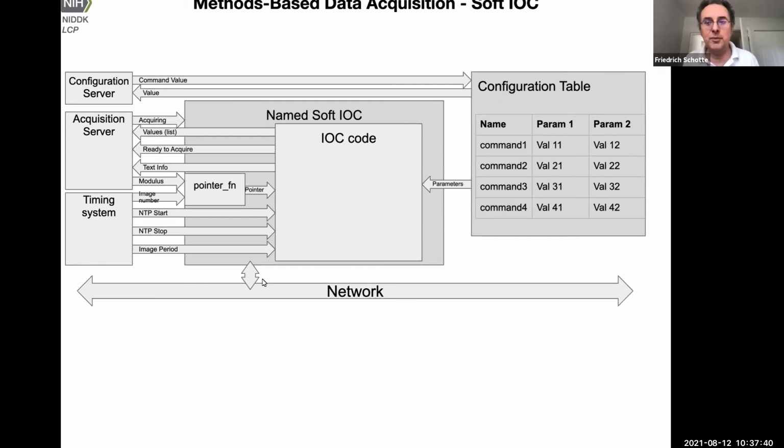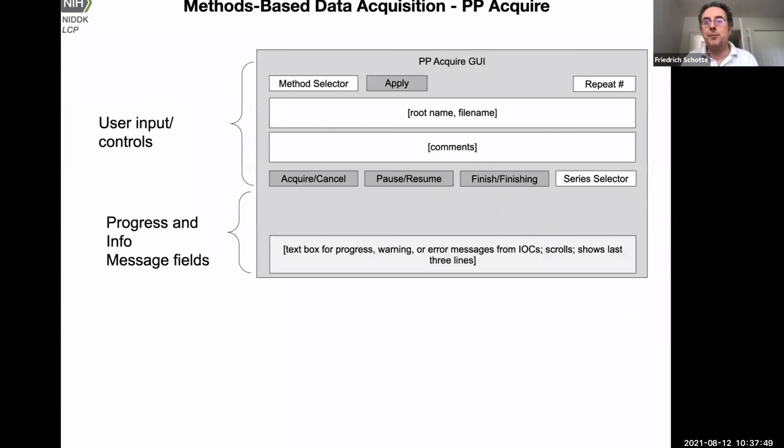And this is a modular principle of designing acquisition software, so that keeps things specialized and extensible. That's the data acquisition GUI. I think I already covered it. So the first thing is to select a method, then apply it, and then you have to decide where to save it by entering a directory path. And then you have various controls. Most important is, of course, acquire, so that starts the collection. You have an option to pause or resume. So if something comes up, you can interrupt it and resume the dataset, and it will pick up exactly where it left off.